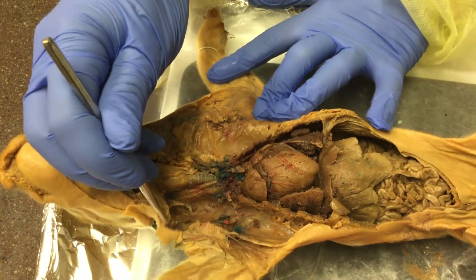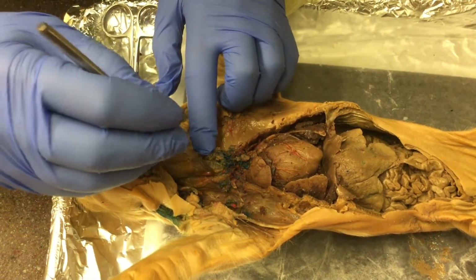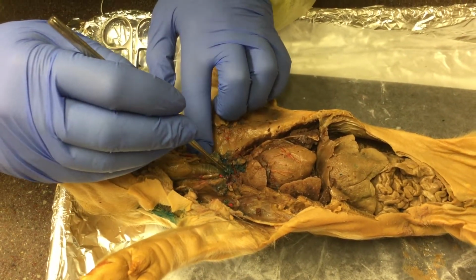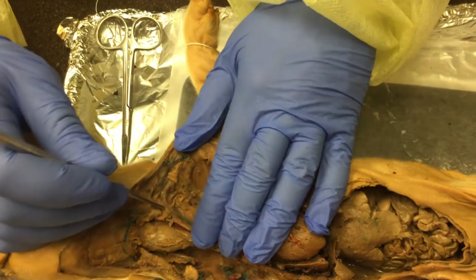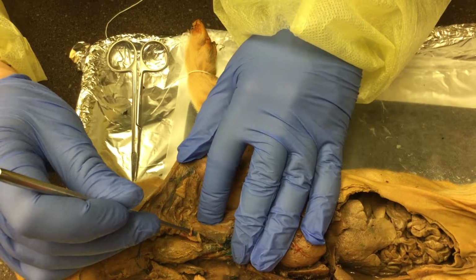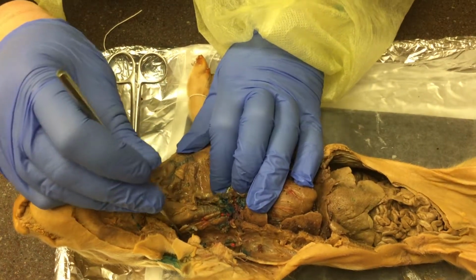So with what we have here, the internal jugular vein is right here. It kind of got cut, so it's a little bit hard to see, but you can see the blue dye of where the internal jugular vein is. Right here on the side is our external jugular vein. That's another area that, when you are feeling your carotid pulse, a lot of times you're pressing on this vein where you can feel your external jugular vein.